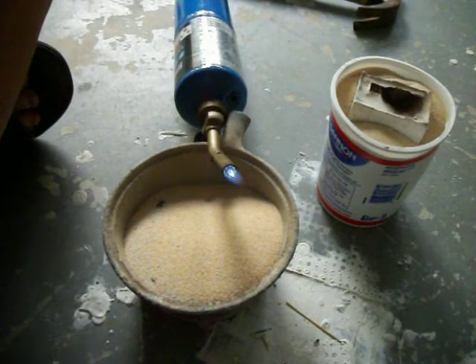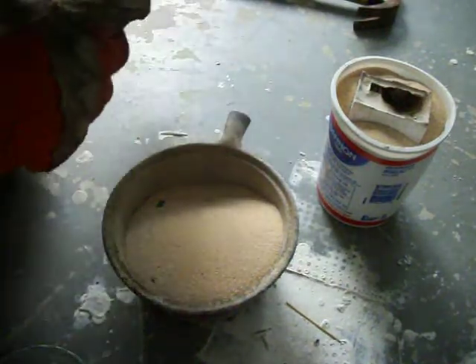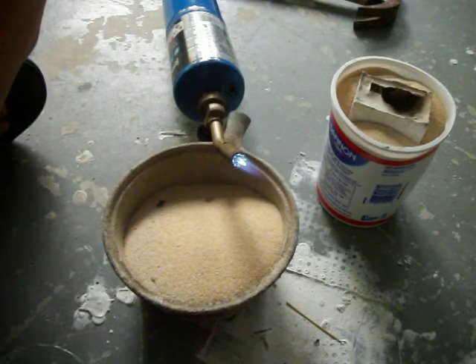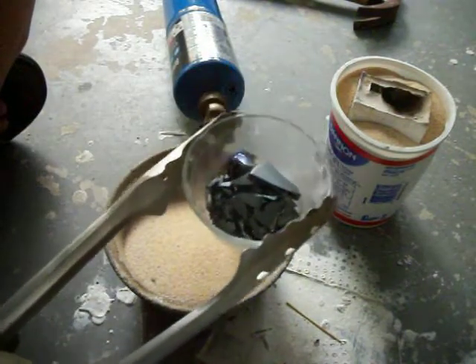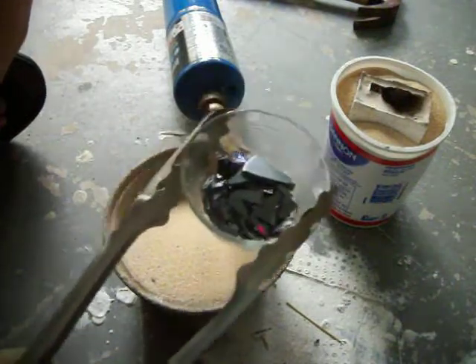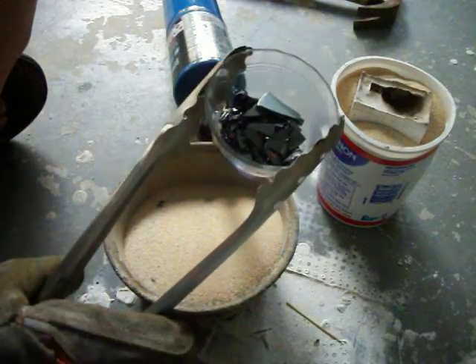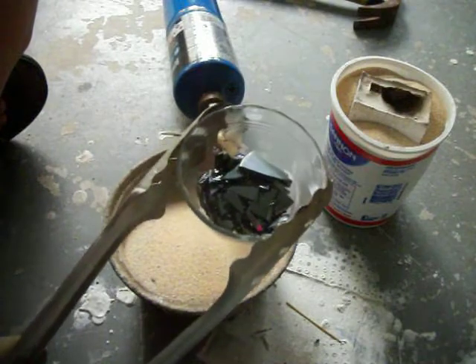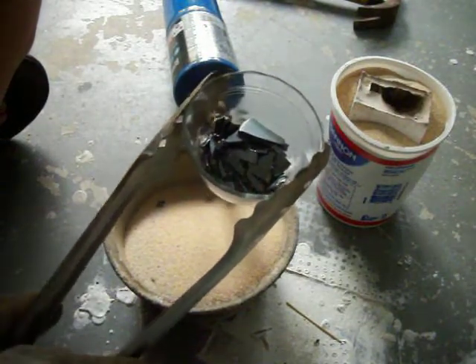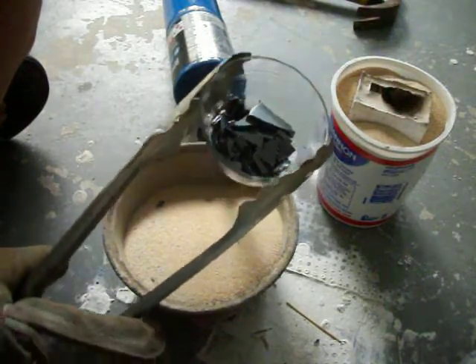I have my torch going here, putting some gloves on, got some tongs to hold this dish. I have this bit of sand here underneath just in case I drop the dish so it doesn't scatter everywhere. I have no idea how long this is going to take, but my hope is to melt this in the pyrex dish. I actually have double gloves on here and I hope I can pick it up with my hands and gently pour it into the mold.